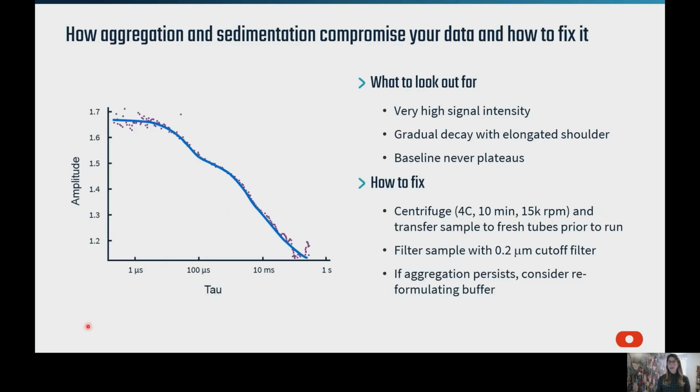If aggregation and sedimentation occur, the ACF is going to have a very high signal intensity and possibly a higher amplitude than expected at a given concentration. So large particles aren't moving, or they're moving really slowly. So your decay is also going to look very gradual, rather than that sharper decay we've been seeing in the previous slides of the autocorrelation function. You're also going to see an elongated shoulder of that decay and a baseline that never plateaus.